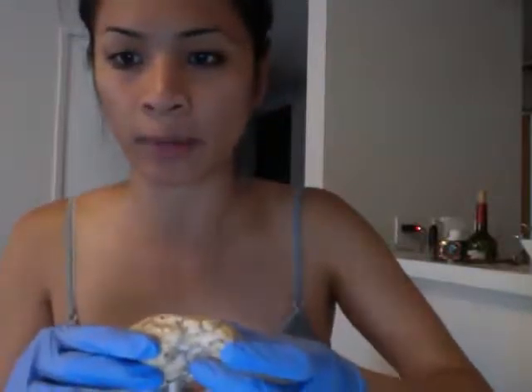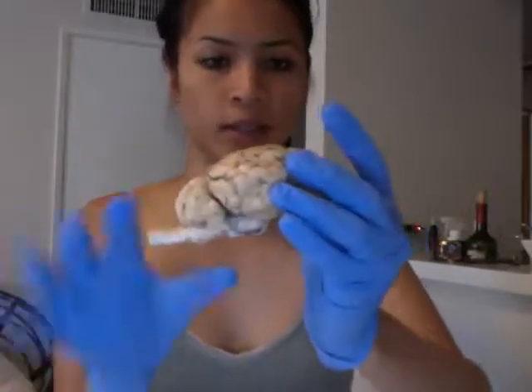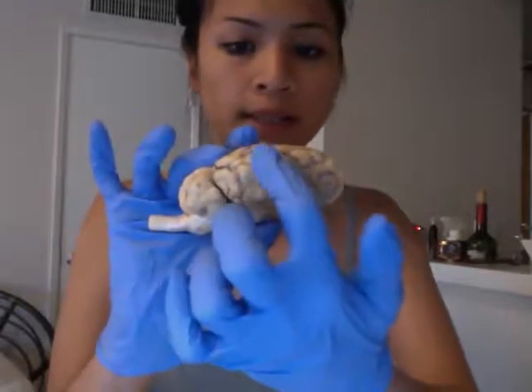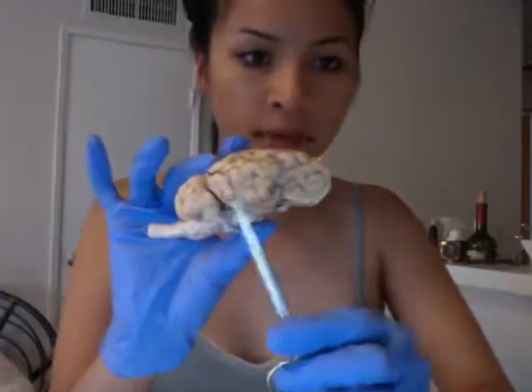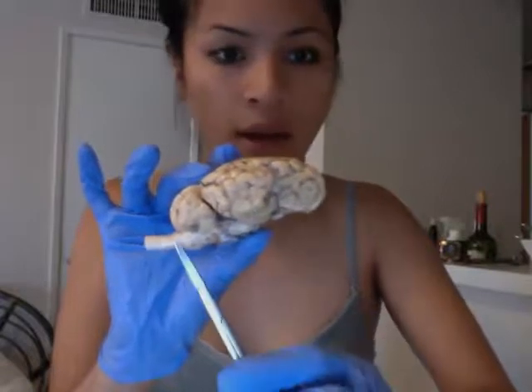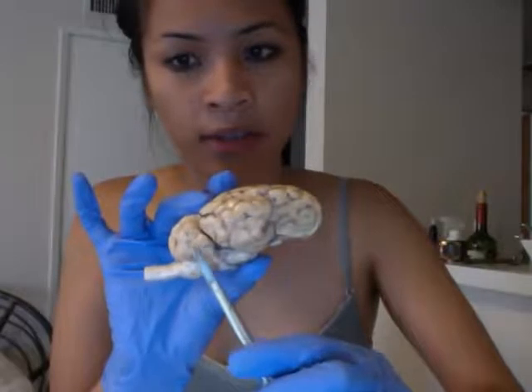It says to identify the frontal, parietal, temporal, and occipital lobe from this view. The frontal lobe is this part because this is the spinal cord — that's the back of the brain. The parietal lobe is this upper part right here, and temporal is right here where the temple would be, and occipital is the back right here, just like a human brain.